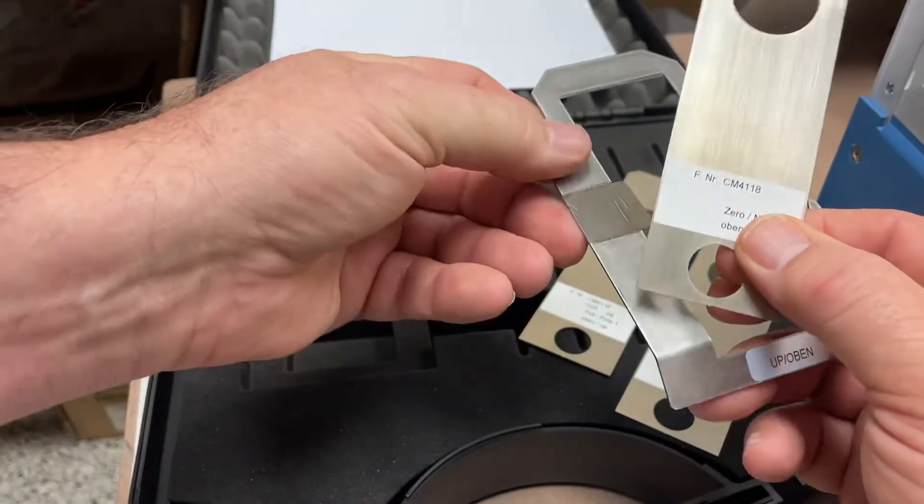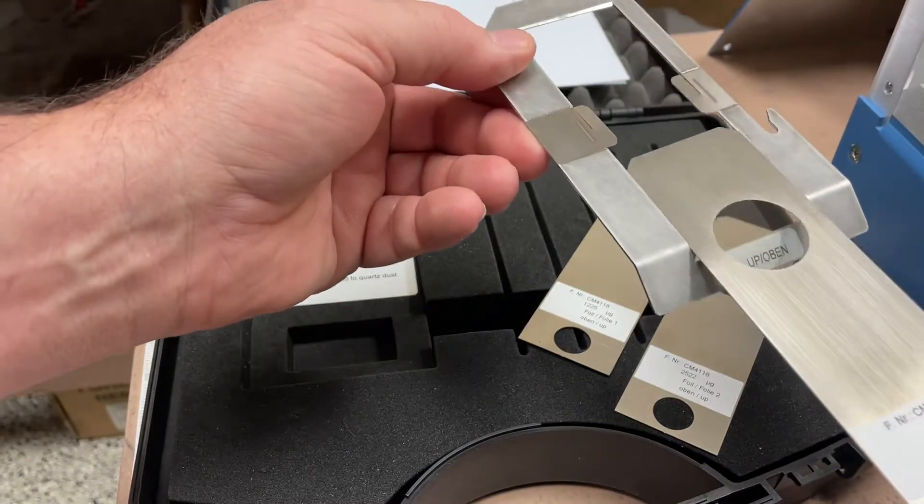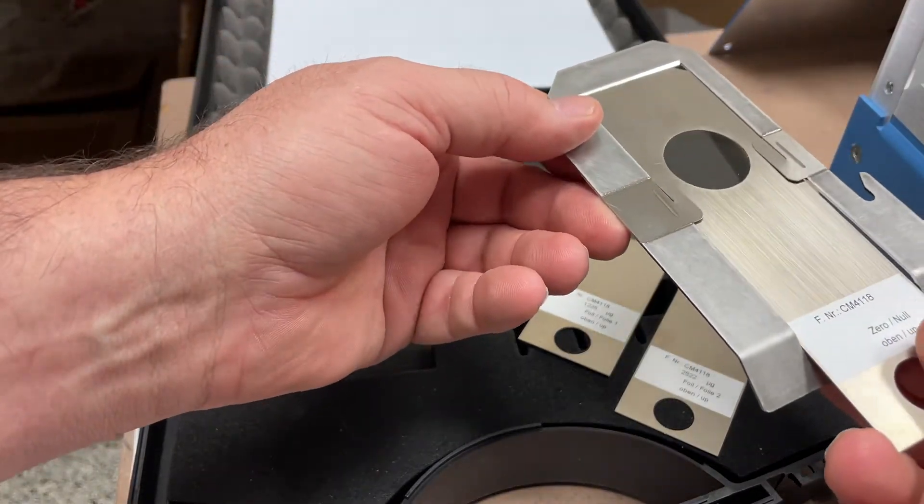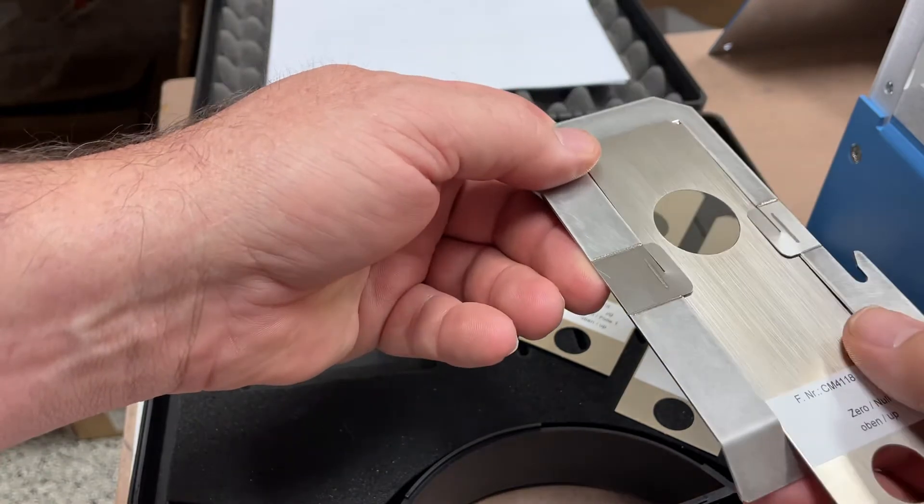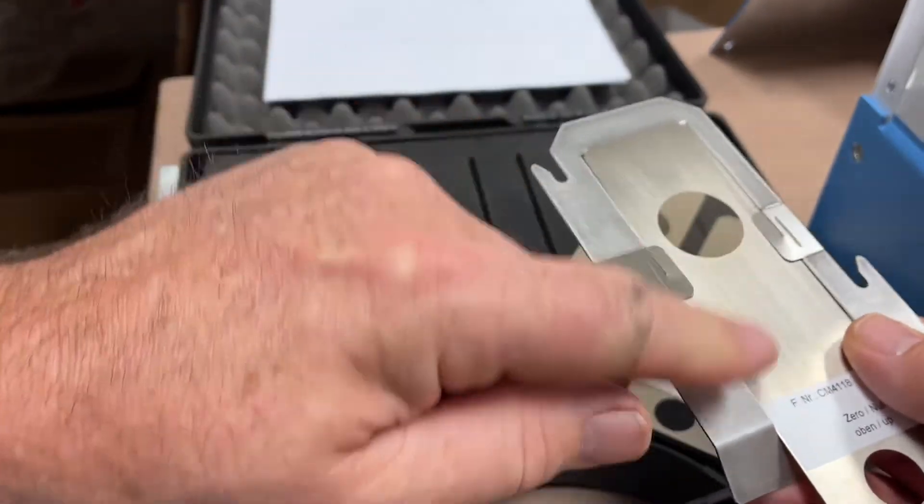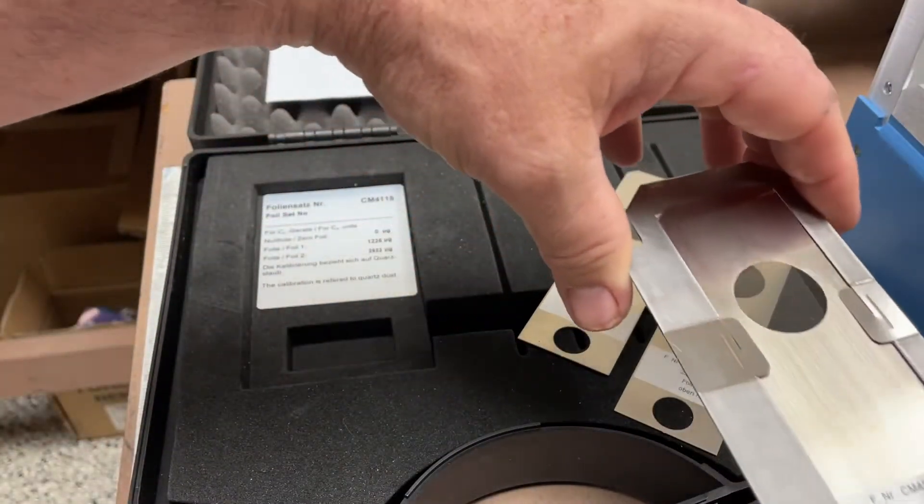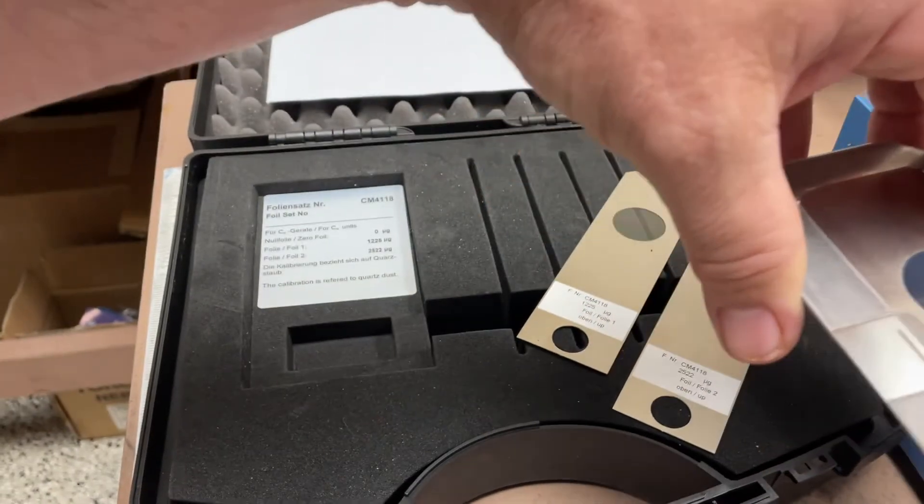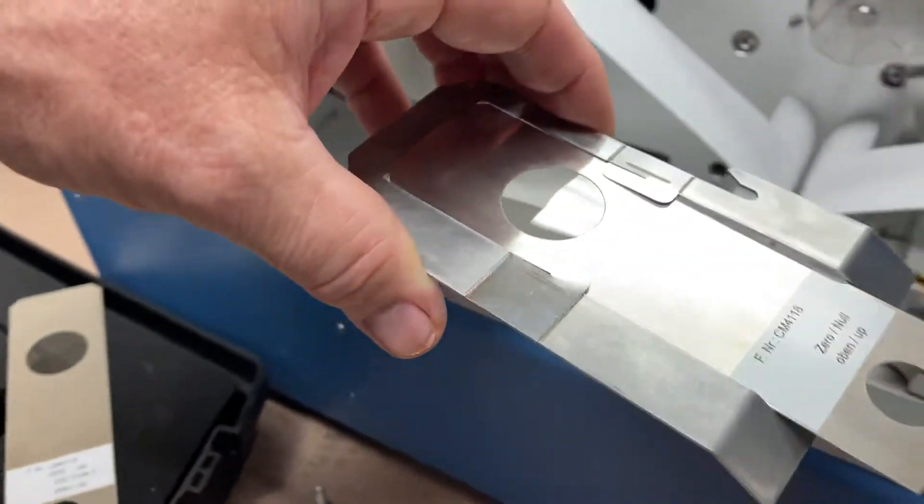We take one of the foils and simply slide it in under the tabs right there, just touching the front of the bracket. It will be inserted into the detector.